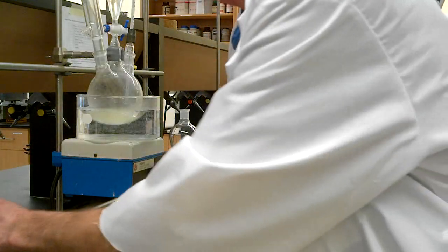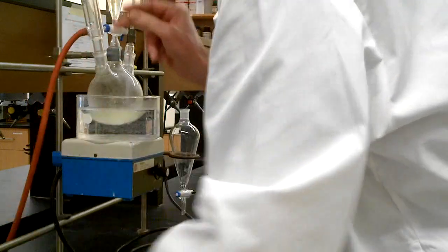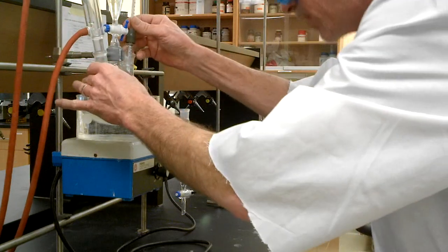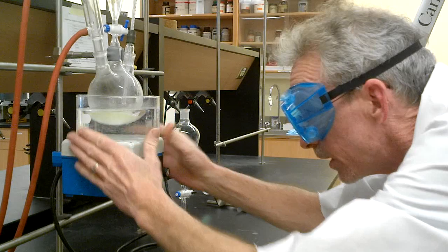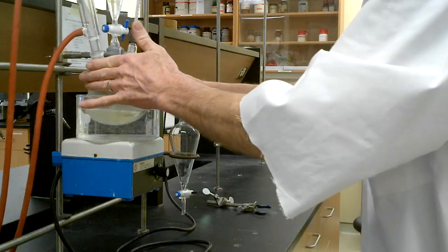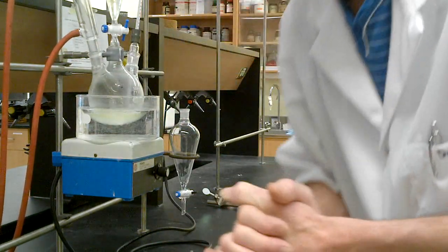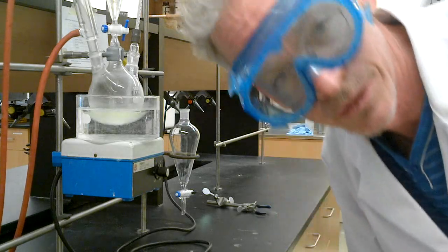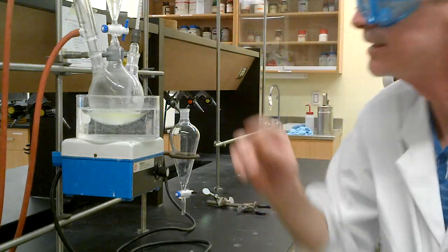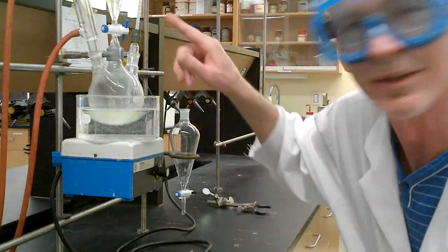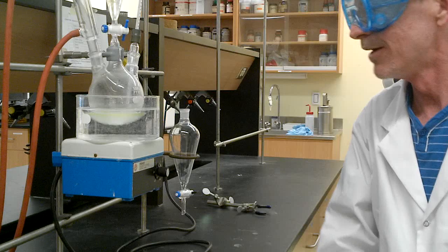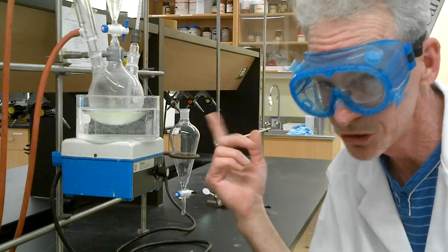We need our cooling water in the bottom, out the top, and our thermometer just touching the liquid down there and our bath in place. Everything looks just peachy. We'll have to add the bleach in two portions because the sep funnel is not big enough to hold the amount we need. So we're doing it in two shots. Right on. Everything looks good. Fast stirring.